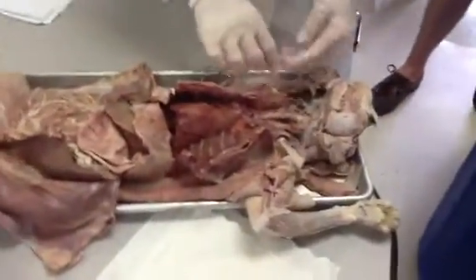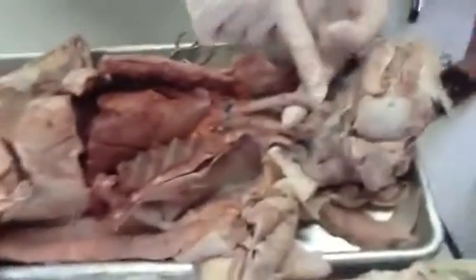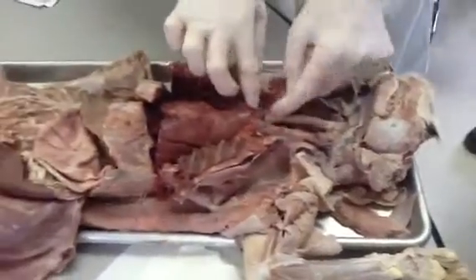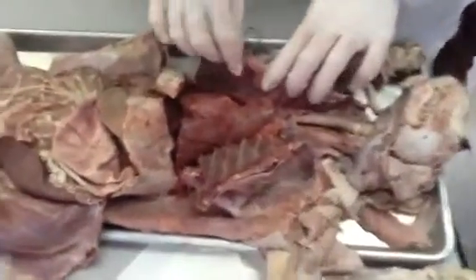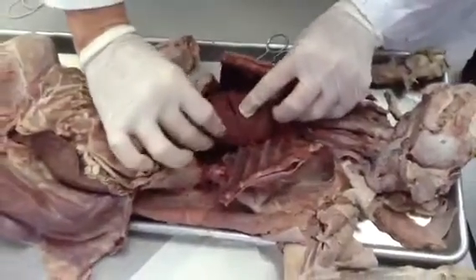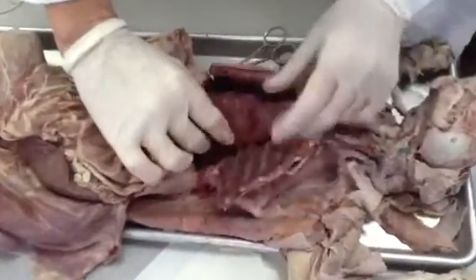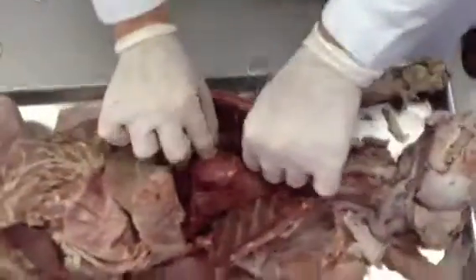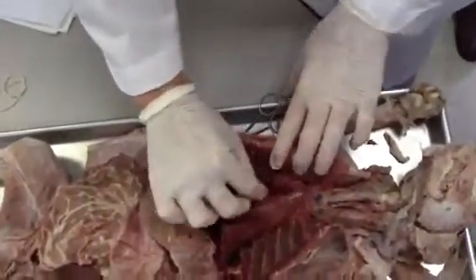Okay. Starting at the anterior part of the animal, this is the trachea. It is part of the respiratory system. You can see the cartilaginous rings in it, giving it its firmness. It's going to go down into two tubes, which are going to be the bronchial tubes, which you cannot see right now, which lead into this lobed organ in the thoracic cavity. Lateral to the heart, this is the lung, multi-lobed, and the lung on this side here is here.